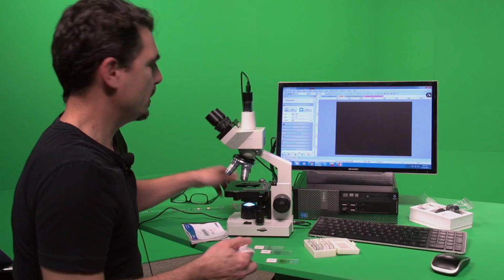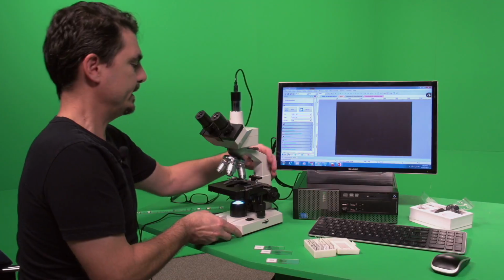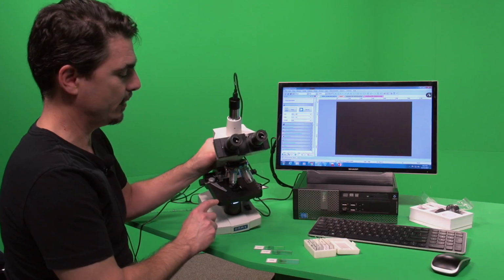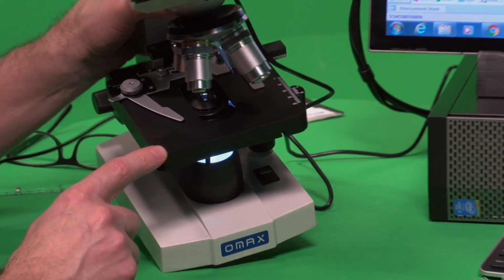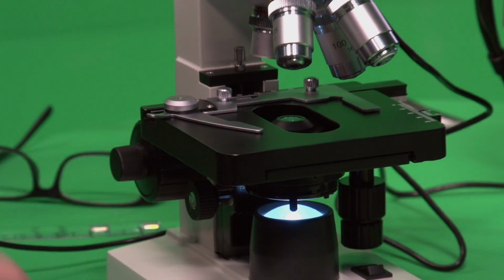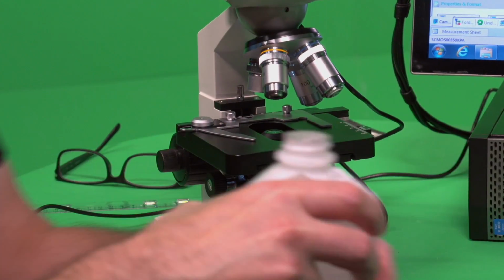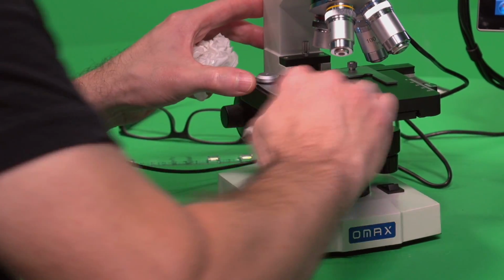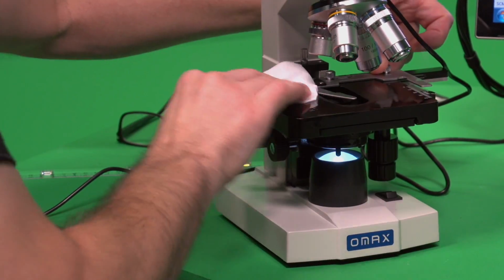All right. So then the other thing, in terms of your microscope itself, I'm seeing that I've got oil bits around here. This is your microscope, so certainly do with it as you will. I don't know if you can see it there. Yeah, you can see a little smudge, maybe not. Typically what I do is I just take lens paper or another paper towel, some type of Kimwipe, and some ethanol or isopropanol, the same that I'm using for other parts of the lab, and I clean off the oil. I move the slide holder out of the way.